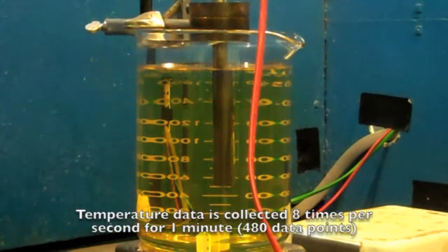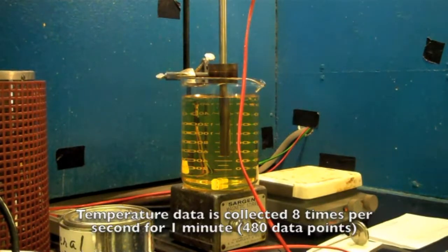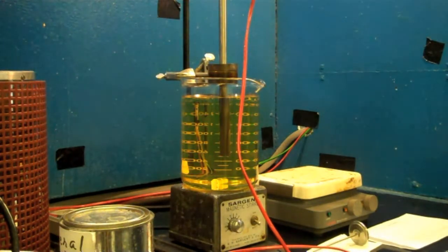The computer program collects temperature readings 8 times a second for a minute. So our cooling curves are generated based on 480 data points. When we first put it in, you could see it going through the vapor phase, which is the initial part of the cooling curve. Once that ceases, we enter into the nucleated boiling phase and then into the convection phase.